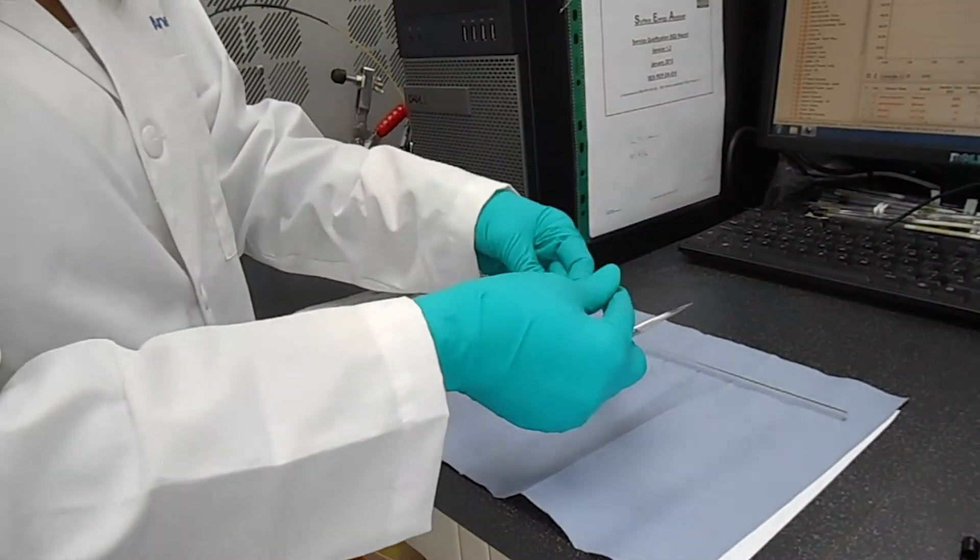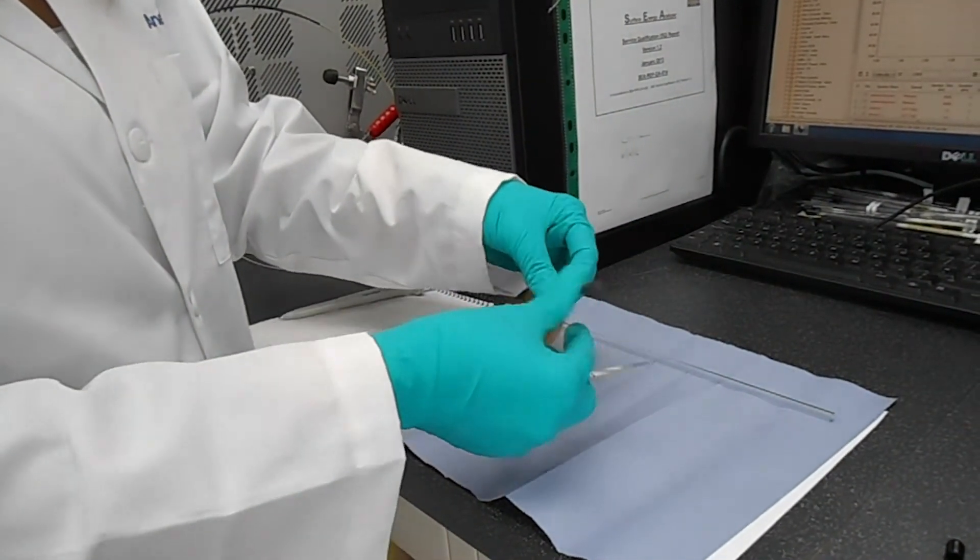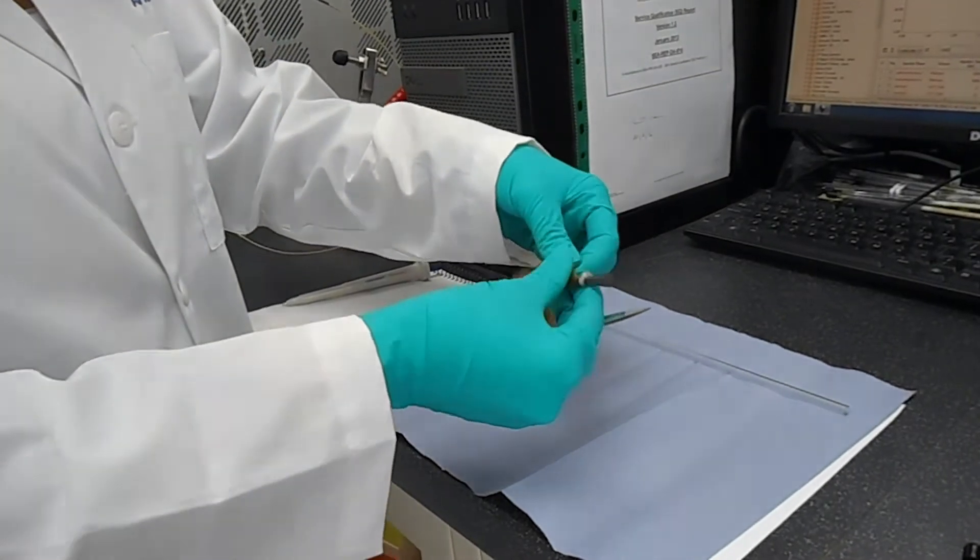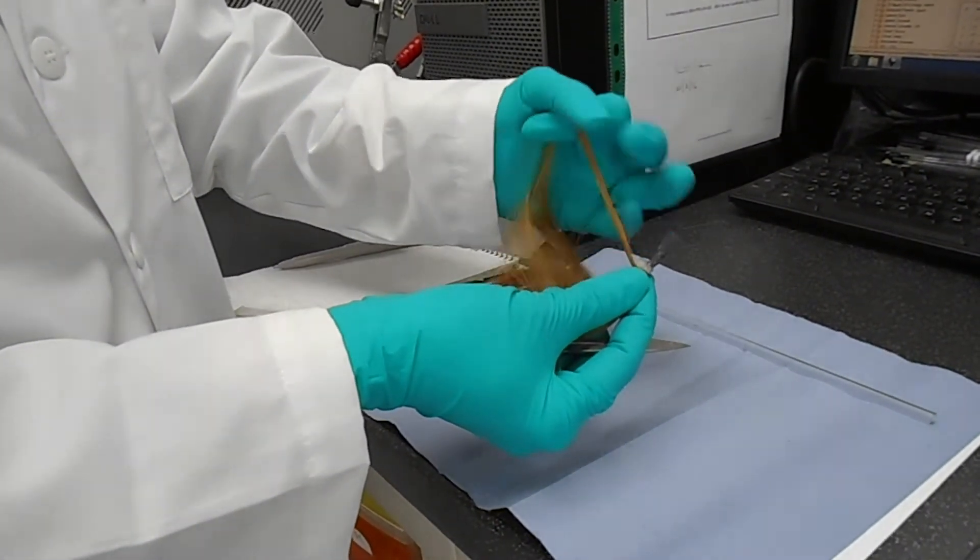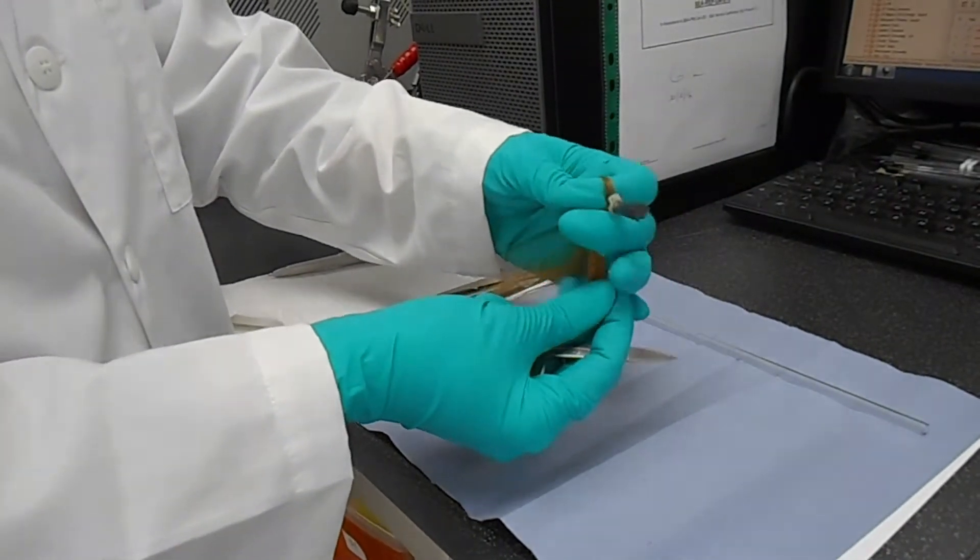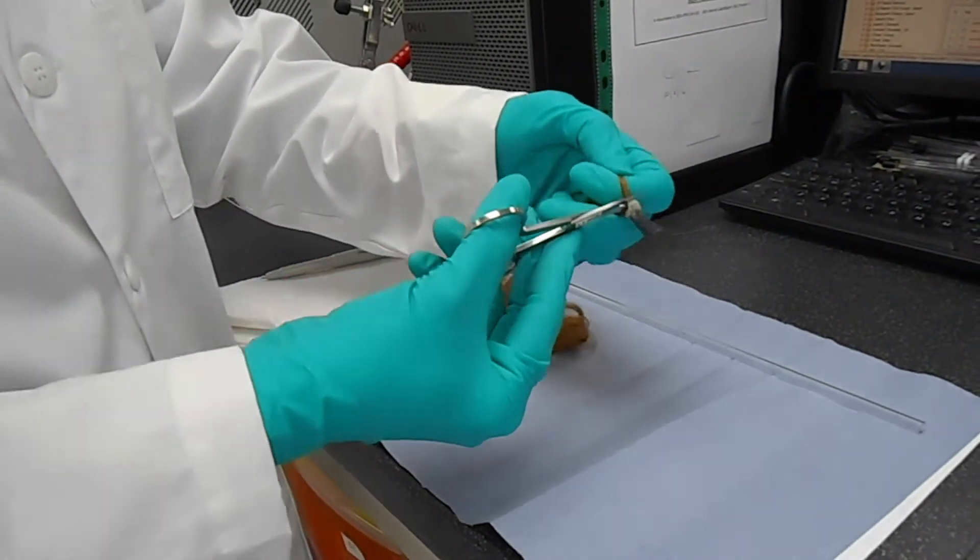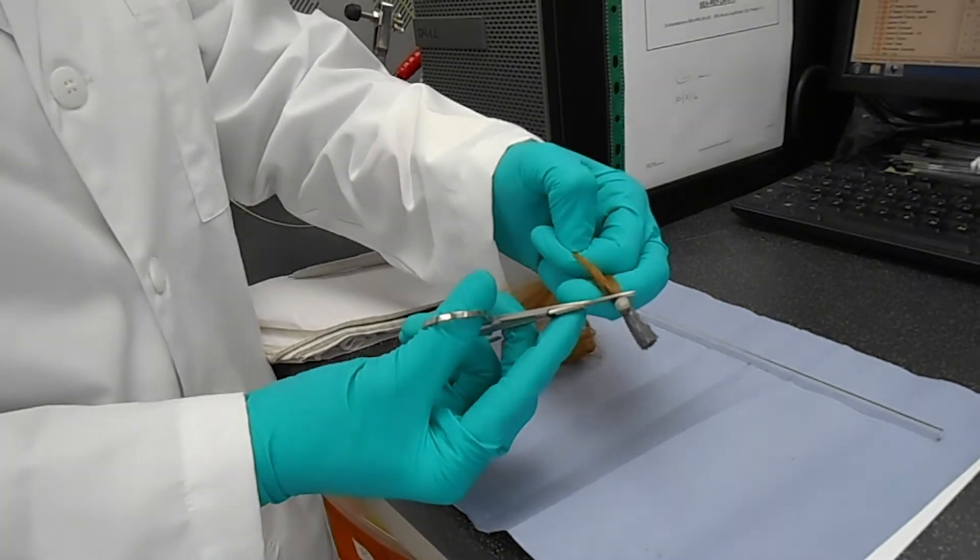After that we can actually start loading the sample. What we want to do is cut a four inch length part of the hair, cut a strand of the hair as shown here.